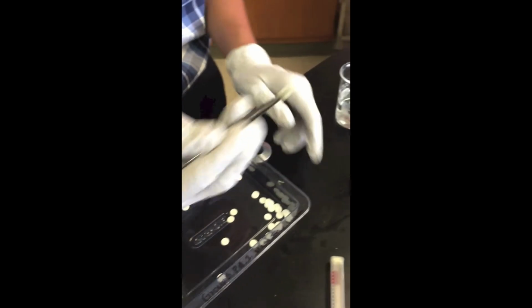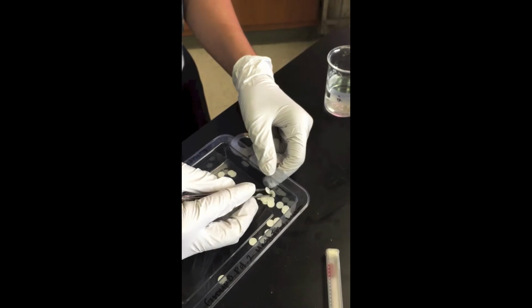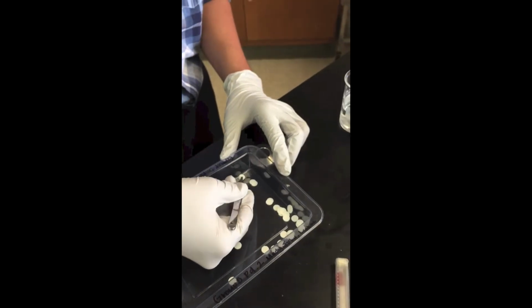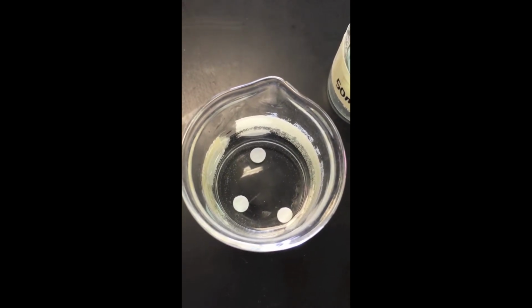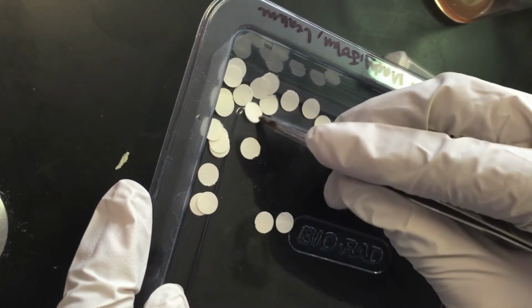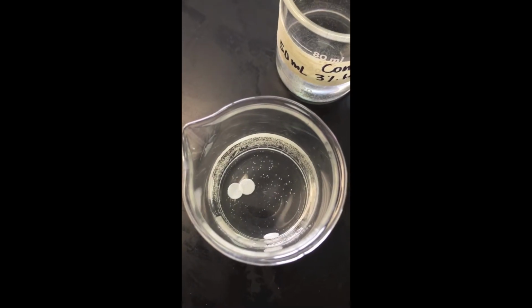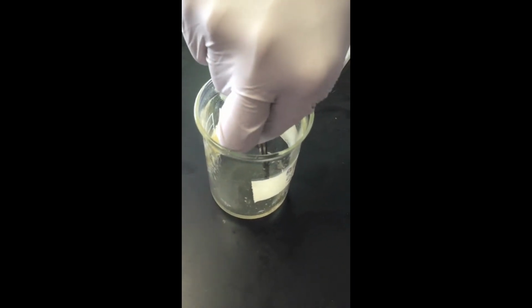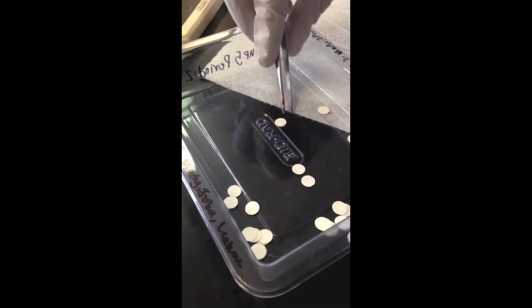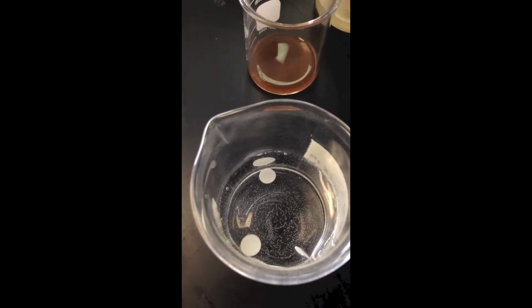In the first control, water-dipped chads were dropped into a 3% hydrogen peroxide solution. The reaction rates were then recorded. In the second control, dry chads were dropped into water. The reaction rates were recorded once again. In the last control, boiled potato catalase-dipped chads were dropped into a 3% hydrogen peroxide solution. The reaction rates were recorded once again.